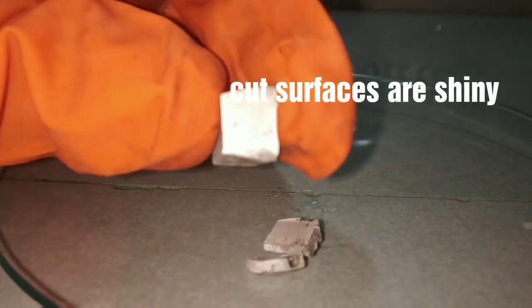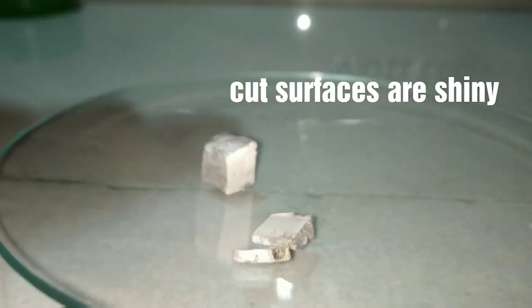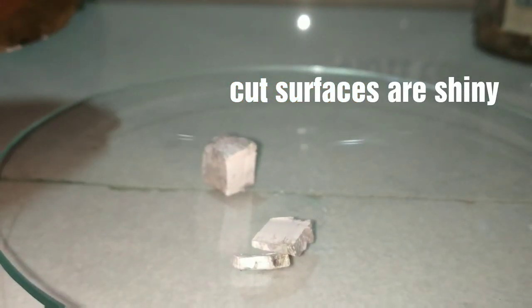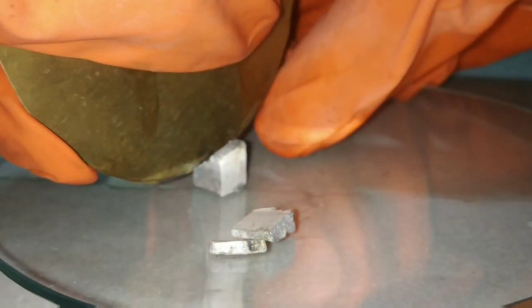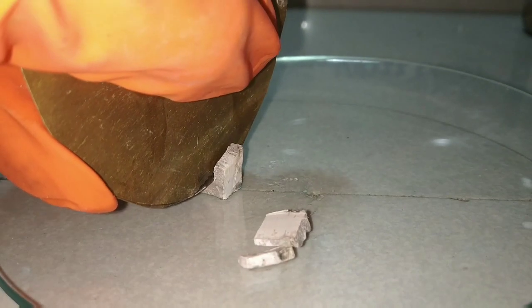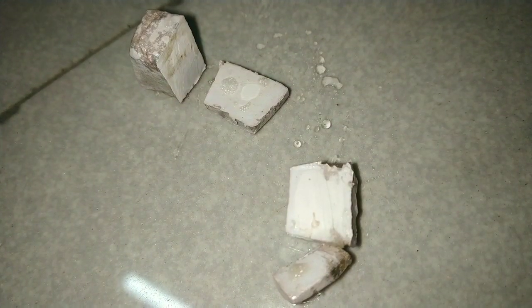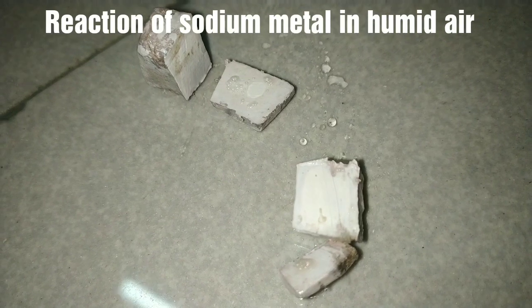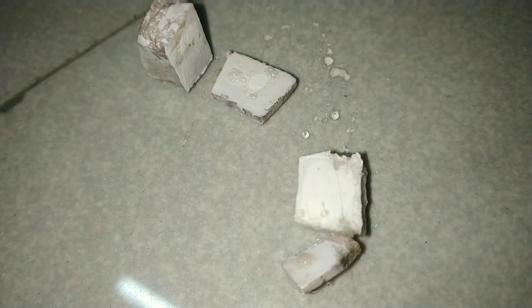You can see the cut surface now, it is very shiny and reflecting the light from my camera. Soon after cutting those pieces of sodium, you can observe a vigorous reaction on them. That is because of the presence of high humidity in our atmosphere here.